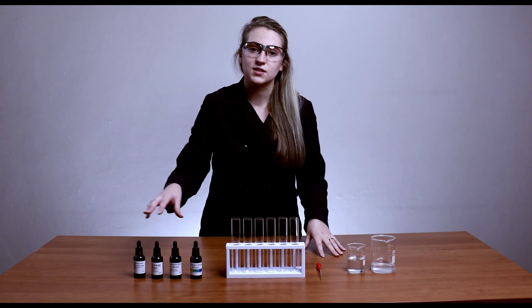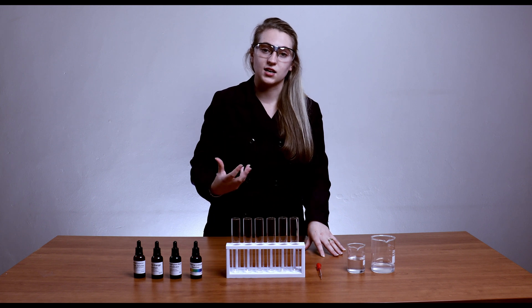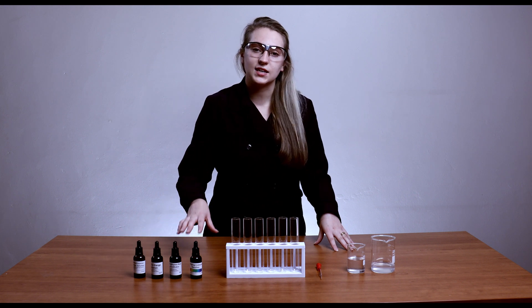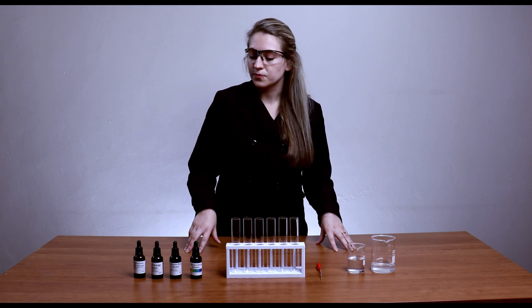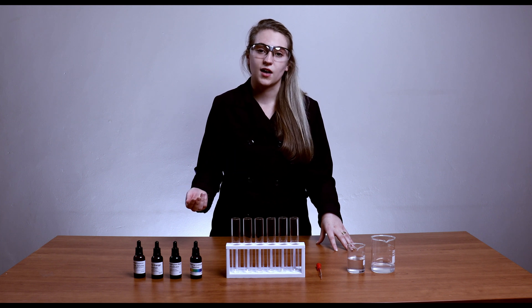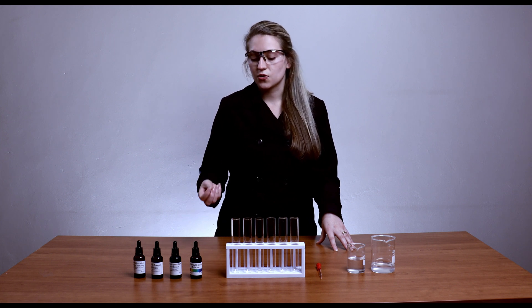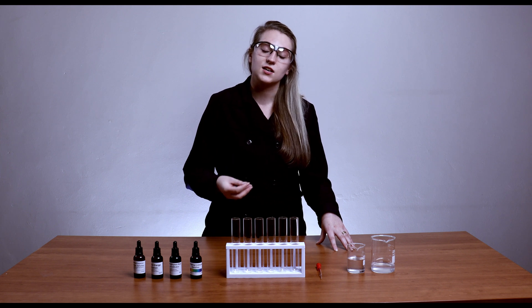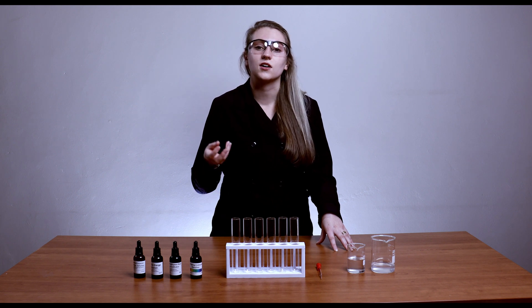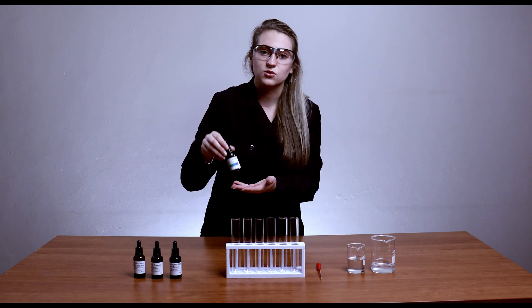I'm going to take each of these indicators, put it in each of these solutions, and then we will observe the different color changes. Generally when we do titrations, these are the most common indicators we will be working with. You can also use litmus paper — red litmus and blue litmus — and we also have universal indicator paper. I'm going to start off with the most simple and common one, which is just your normal universal indicator.